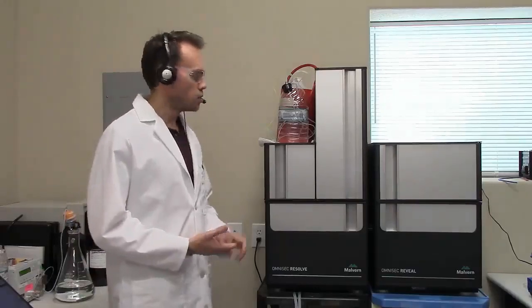After that, we're going to purge the RI, purge the DP, and purge the IP to make sure that all our side and purge lines and reference cells are all flushed out and have the salt removed as well. So we're going to probably run for about 15 minutes or so like this. Then I'm going to do some purges, and then we'll come back and switch to THF.